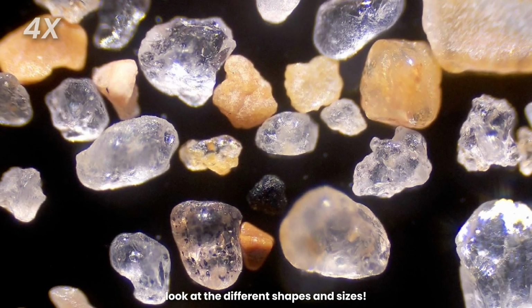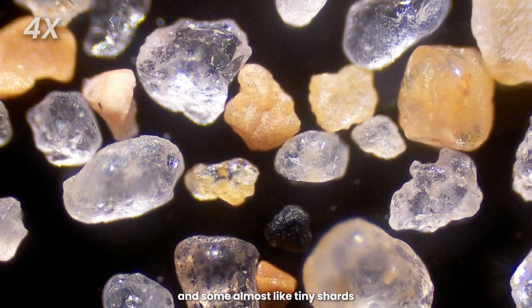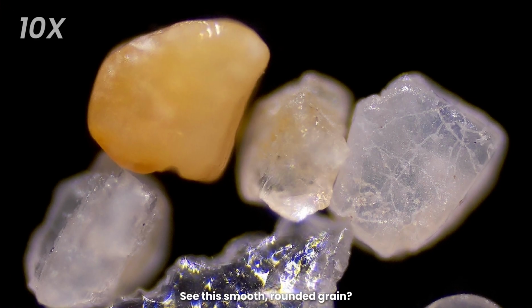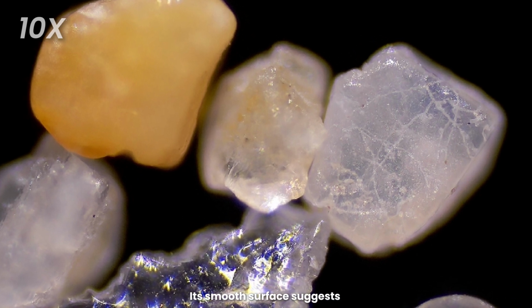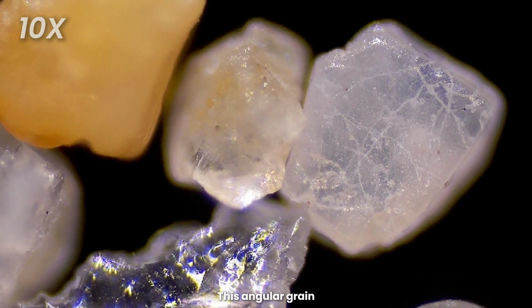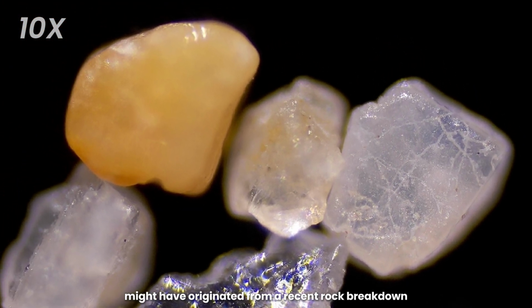Wow, look at the different shapes and sizes. We have some rounded grains, some angular, and some almost like tiny shards. See this smooth, rounded grain. Its smooth surface suggests it's been tumbled by water or wind for a long time. This angular grain, however, might have originated from a recent rock breakdown.